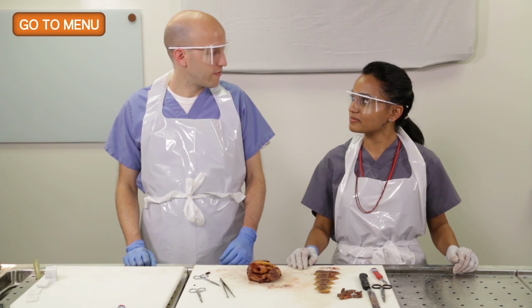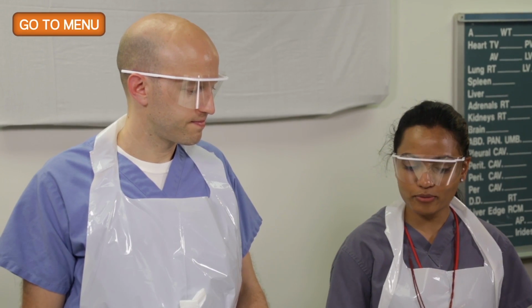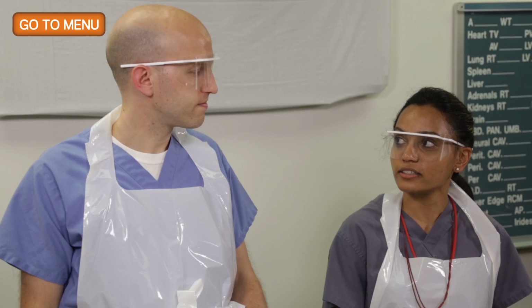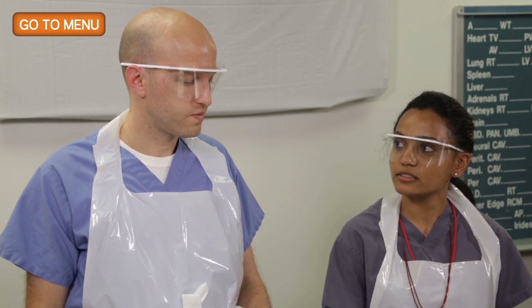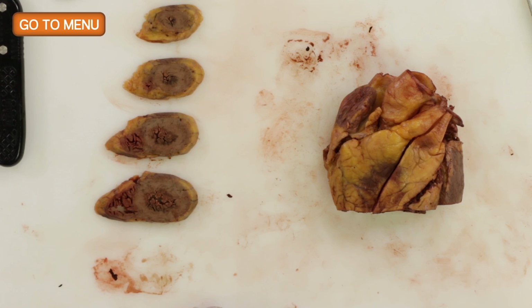So that's it. Do you have any questions? Yeah, I actually do have a question. So what if we look at the slides and we actually find an infarct? So if you find an infarct or any other histologic lesions, we'll generally come back to the heart, reevaluate, probably take some more sections, and we keep the organs in formalin for an extended period of time. So we're able to do that.